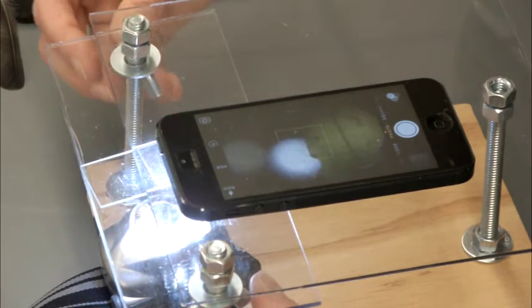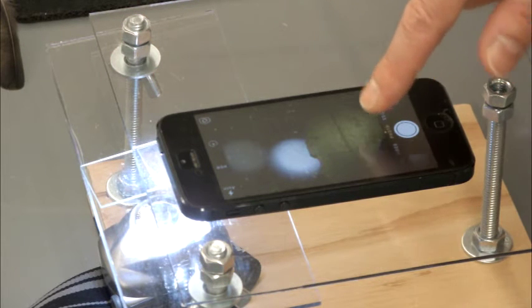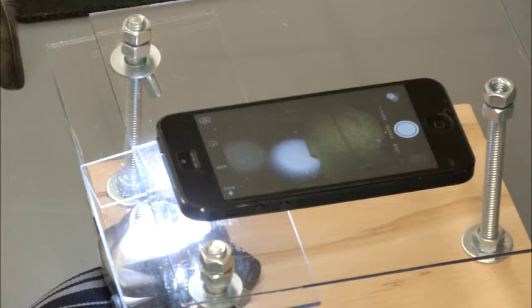So we're just lifting that up there. And I don't know if you can kind of see that. You can see the actual detail of the cells in the Elodea leaf.